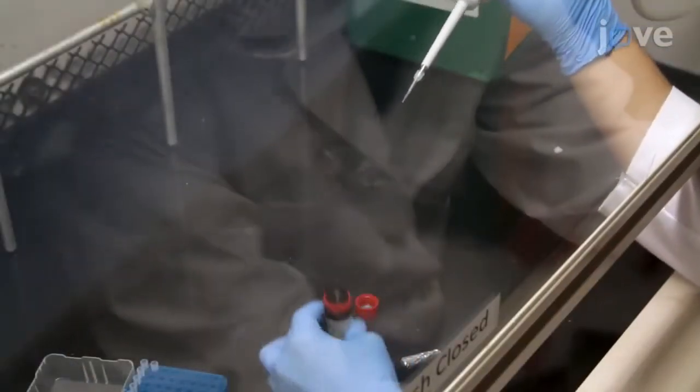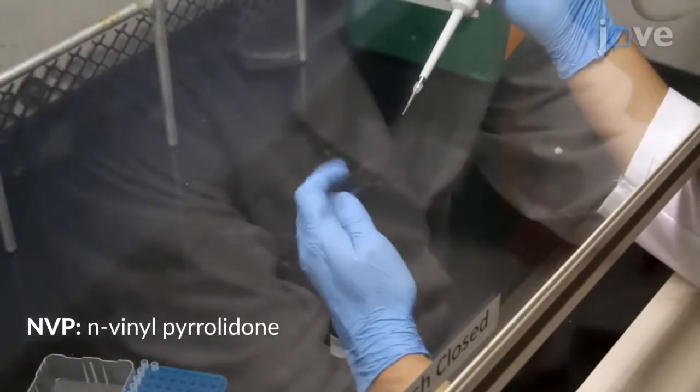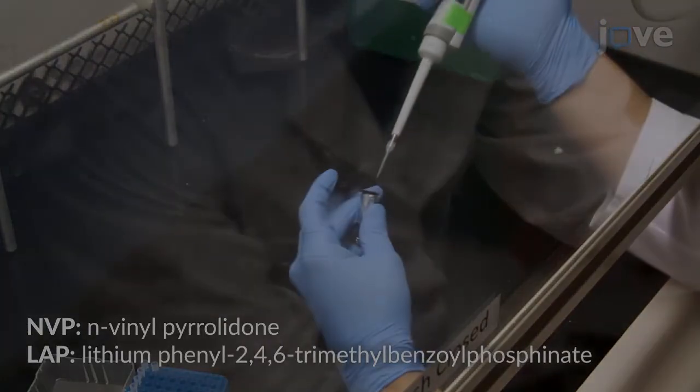Then add 8 microliters of NVP to 800 microliters of the LAP solution prepared for the hydrogel synthesis.